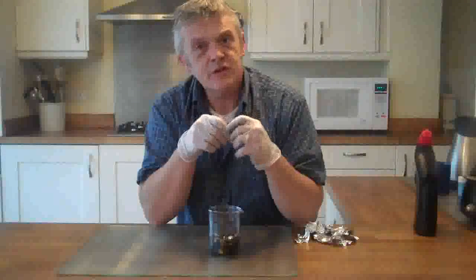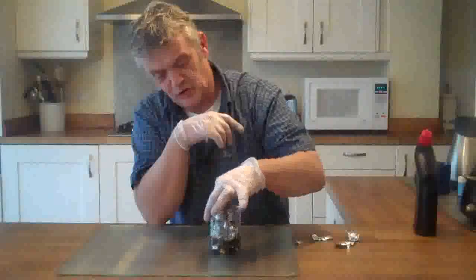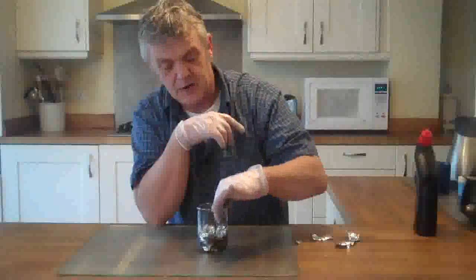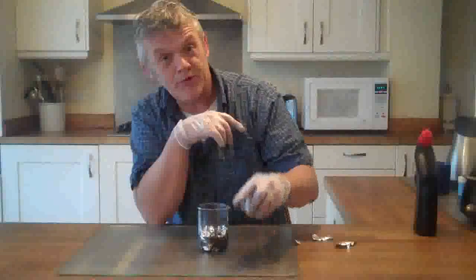And you just filter those little bits of foil back out again, and that's how you get rid of it. So, if you've got a bit too much foil in there, don't worry about it. If you have not enough, then all the foil will dissolve and it'll still have a brownish colour, and you need to add a bit more foil.